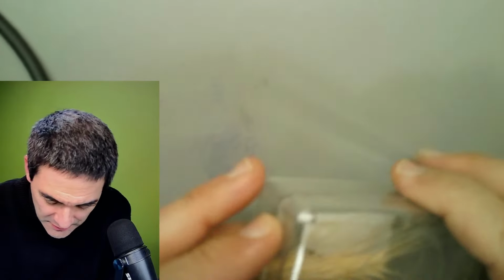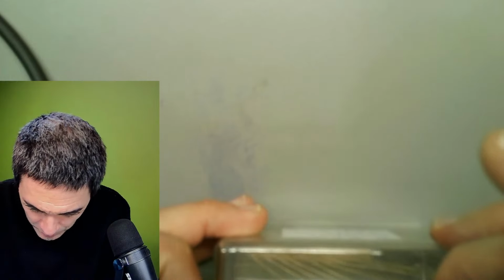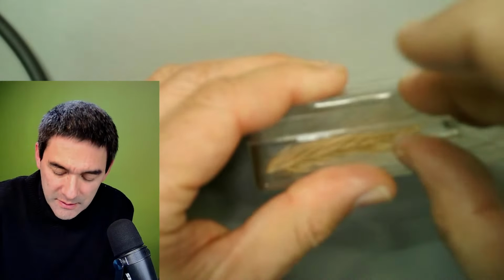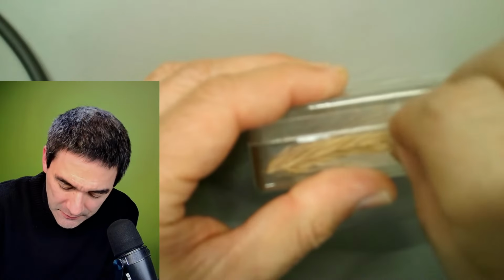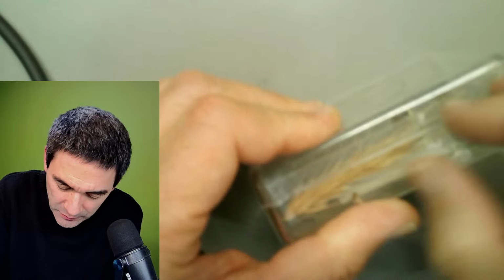It was so scary that I actually even taped it closed. And honestly, maybe I'm just going to open it again, and then I'm going to tape it closed again. I taped it closed because it was open before. Let's open it so that we see it better. This is actually really something.